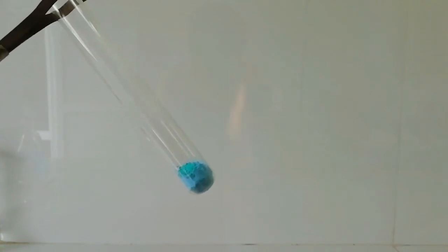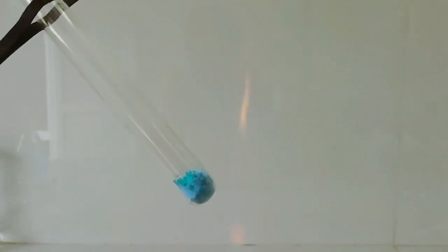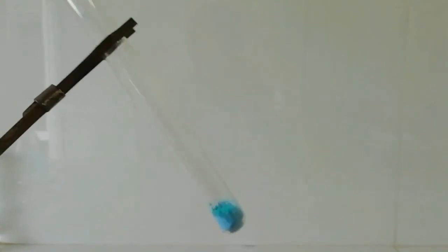That is because the green form is the hydrated form of copper citrate, and this blue form is the anhydrous form.